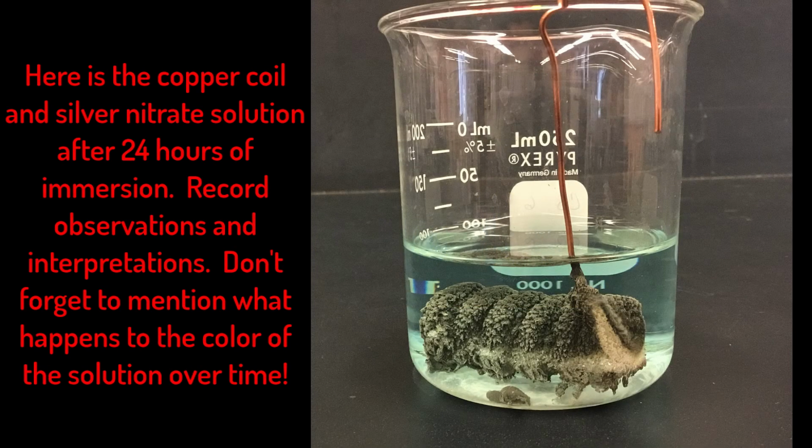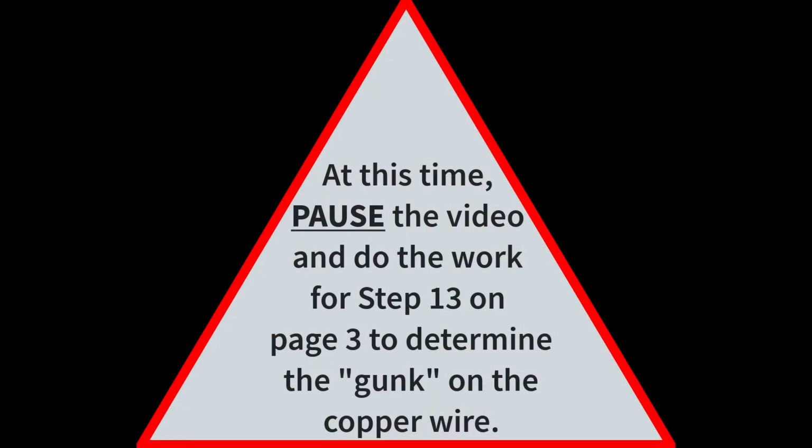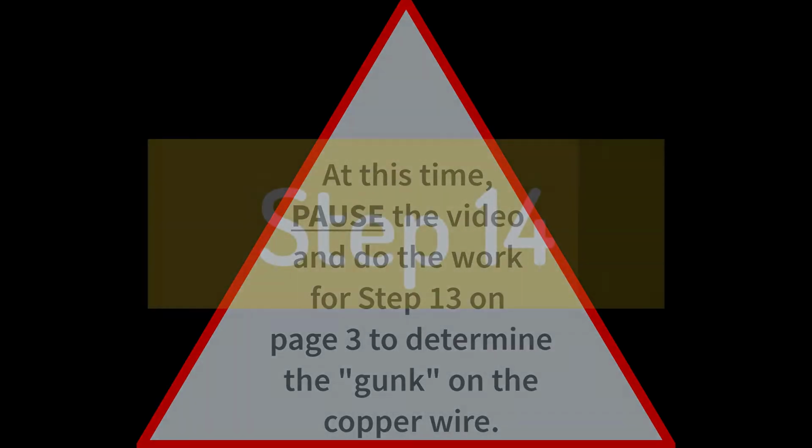Here is the copper coil after 24 hours in the silver nitrate solution. Make some additional observations and then pause the video and go through the process of figuring out what that gunk is all over the copper wire. List the formulas of the substances used in the lab and then use your observations to determine the identity of the gunk.